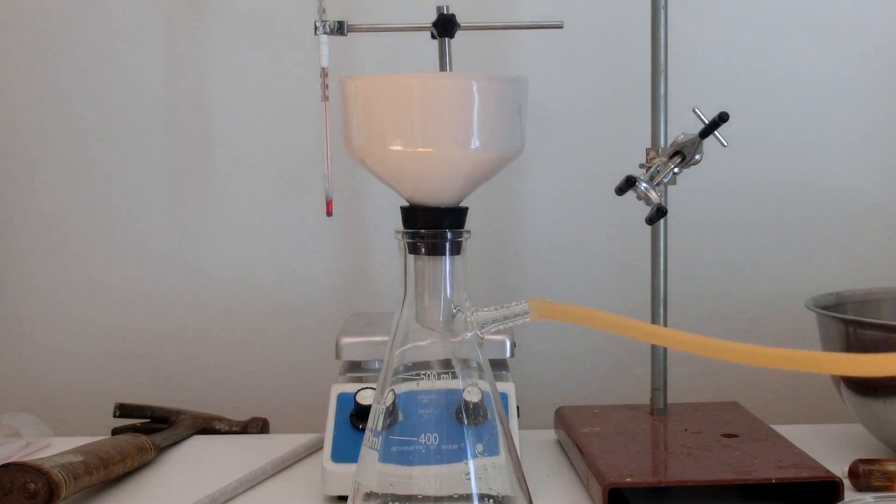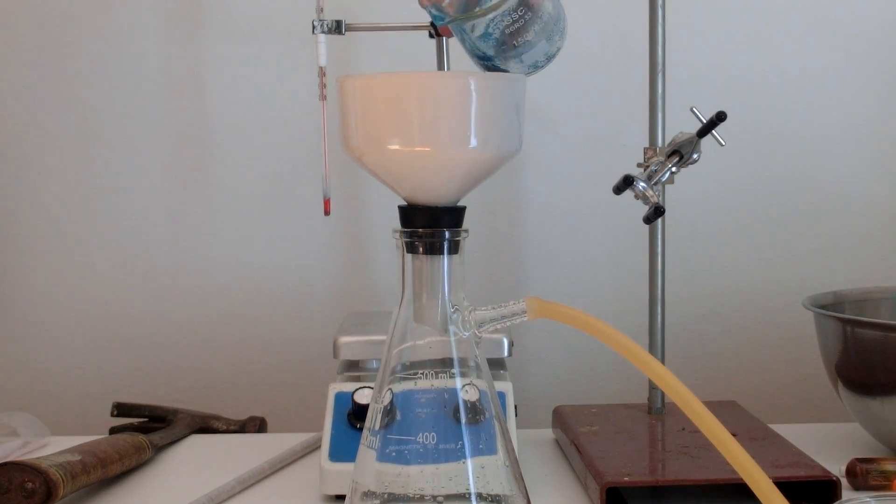Now set up for vacuum filtration. Once your solution has cooled, add it to the funnel.